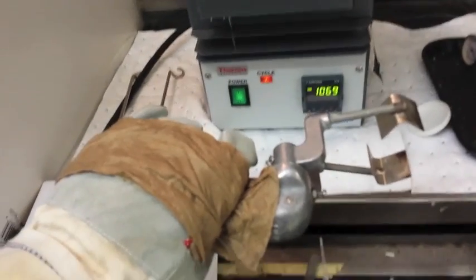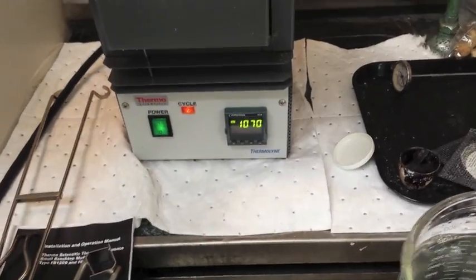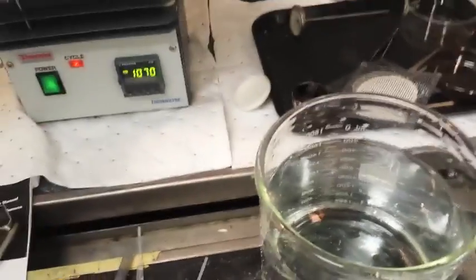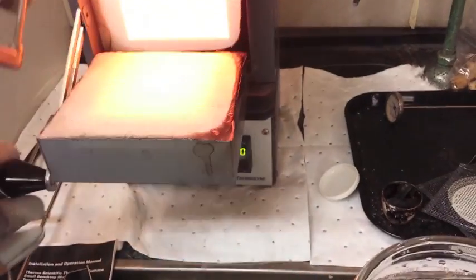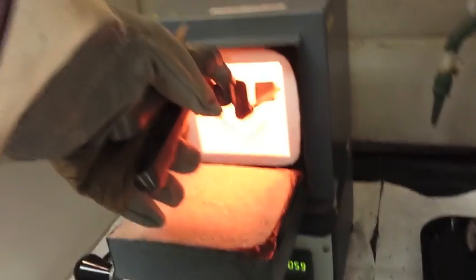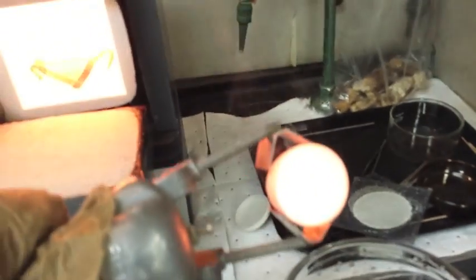I don't know if I'm going to be able to do this one-handed, but we'll give it a shot. Okay. Yeah. Let's see what we're doing here. Oh, nope. It's melted.